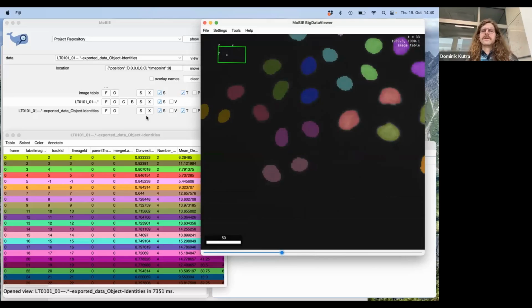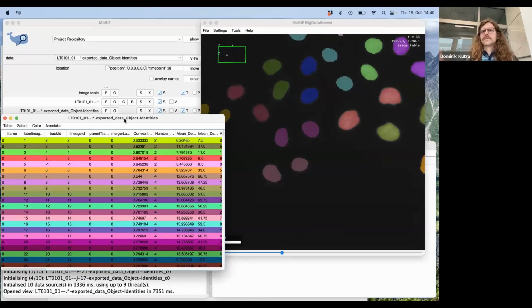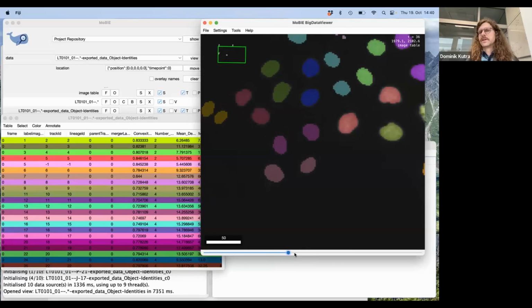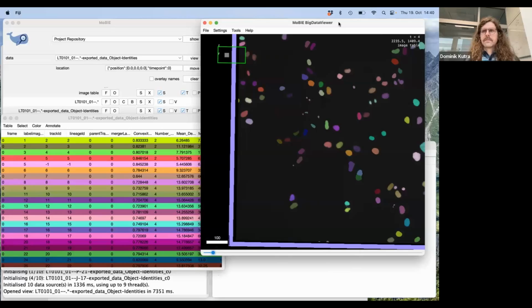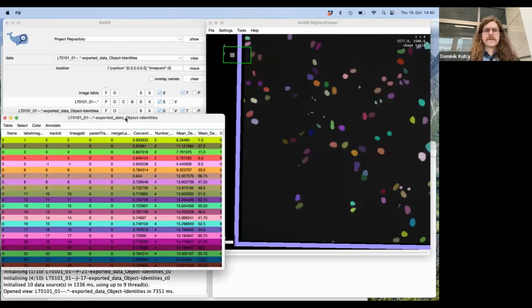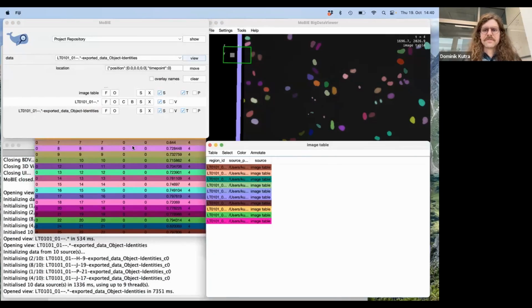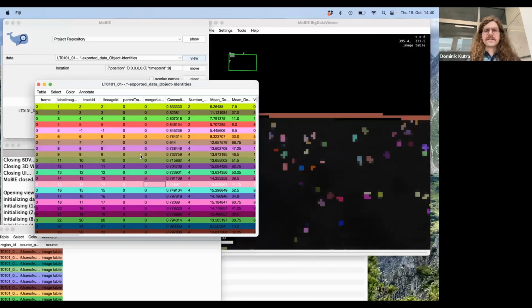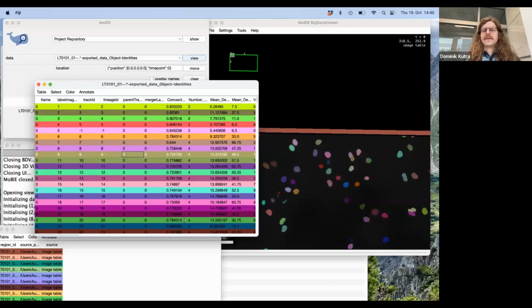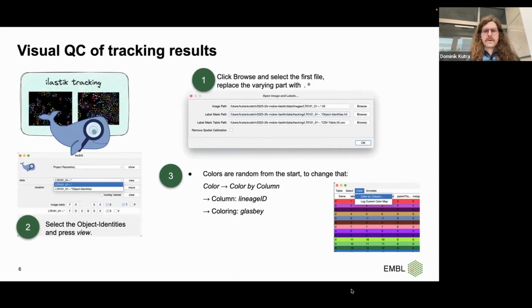And then you can do the same as before, right? You would also add a QC column to your image table and record your findings, like, oh no, tracking has to be redone, or tracking unreliable, or tracking good, or whatever categories you want. That's the object table, and the image table is somewhere hidden here. So here you would add your annotation, whereas here you have all the different cells, and if you click on one, then you get flown to it like before. So basically, everything that Tischer previously showed applies to this kind of table here. Okay, so this was basically what I wanted to show.